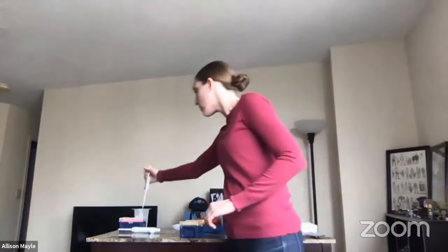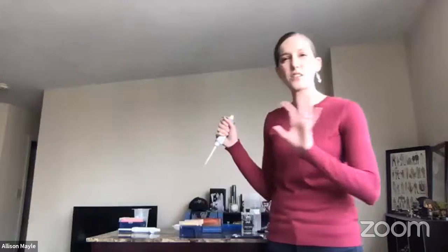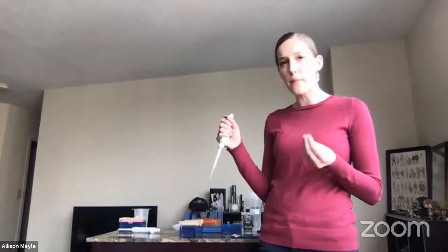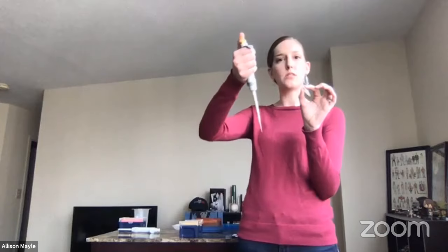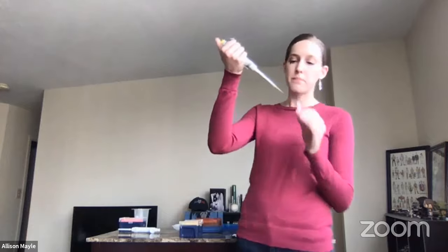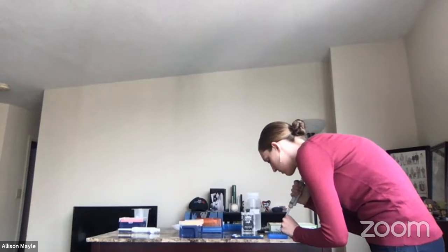I'm going to get a new pipette tip and do the same thing for my CO1 sample, for my invertebrate sample. I don't want to add the wrong primers into the opposite PCR. The invertebrate doesn't have RBCL because it doesn't have chloroplasts, but I still don't want any extra DNA in there that's going to interfere. I'm going to use my CO1 primers — pressing down to the first step, going into the liquid, releasing my thumb — and add that to my second bead.